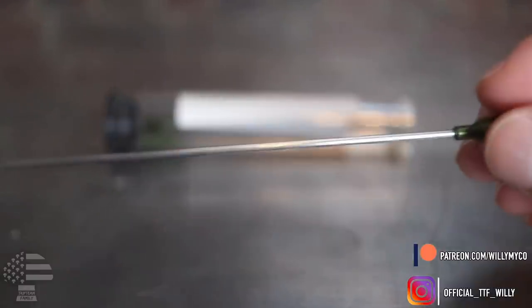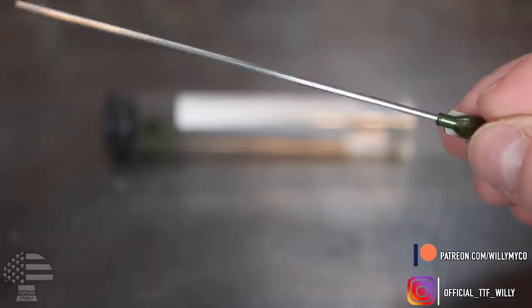The next thing you need is some liquid culture needles — they can vary in size. I like to use 14 gauge, that's my preferred gauge; it's not too big and not too narrow. I like anywhere from three to four inches of length. I suggest using something between 14 gauge and 16 gauge — remember, the higher the gauge number the more fine the needle, the lower you go the bigger and more blunt it gets. Most liquid culture needles are not sterile, so you're going to have to sterilize them before use — but that's not a problem since we do that anyway.